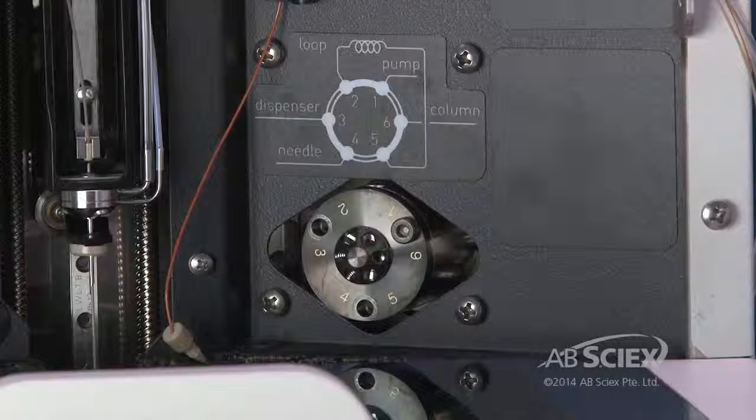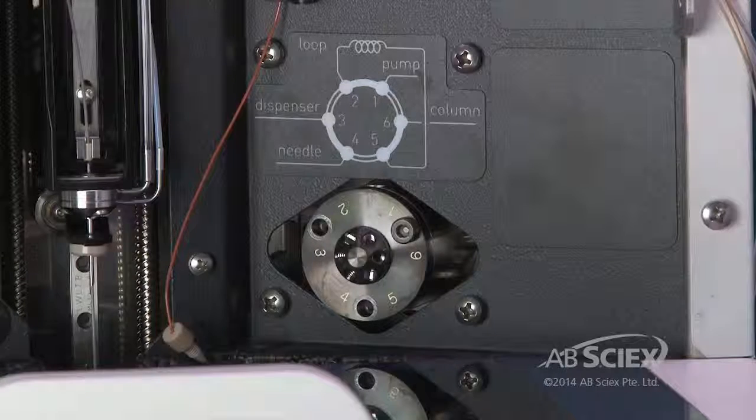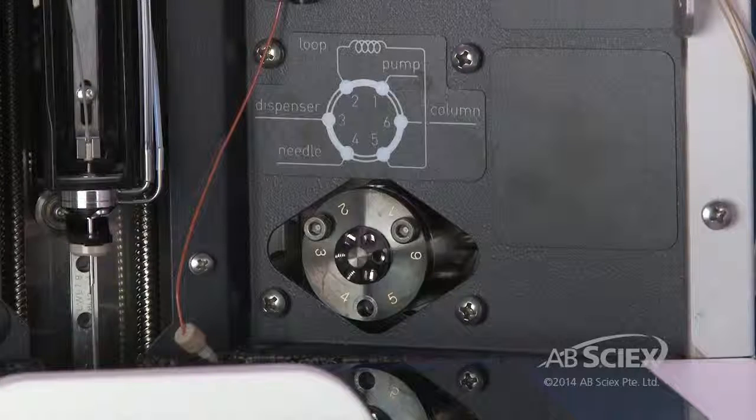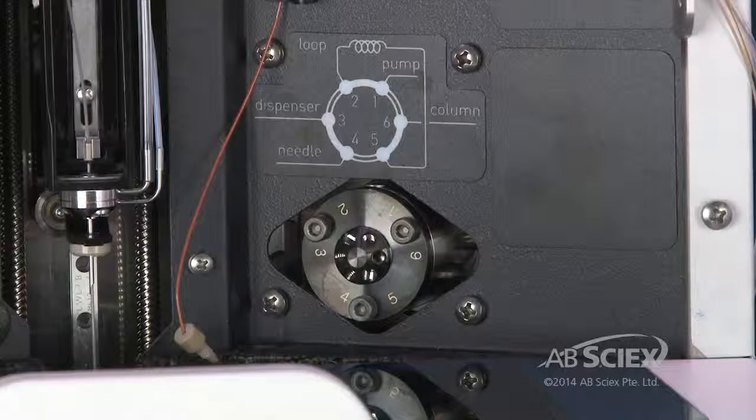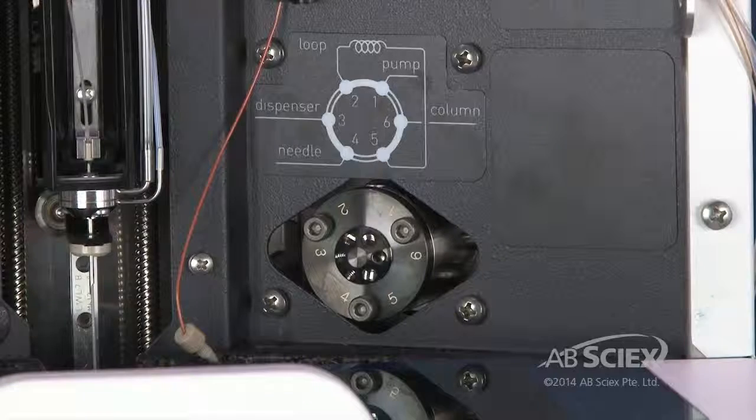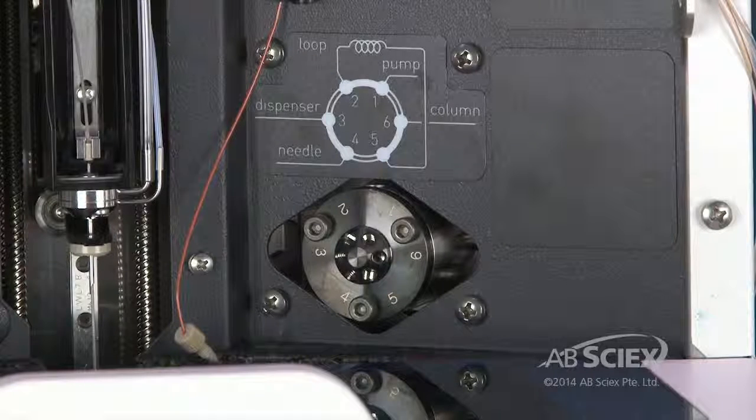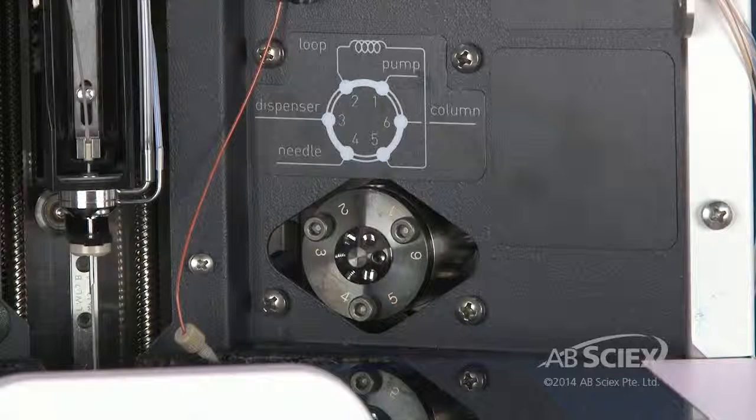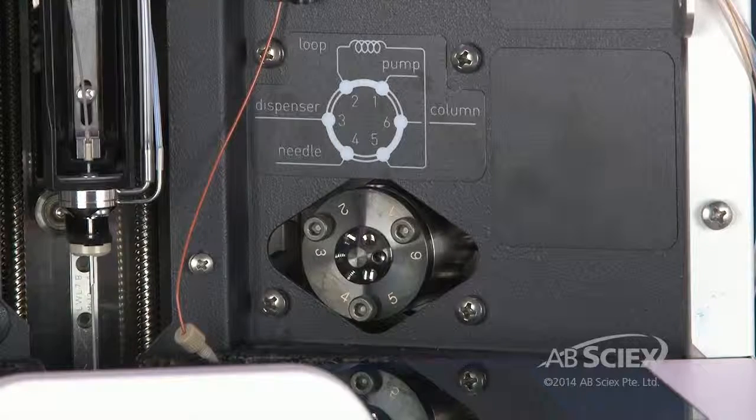Place one of the bolts into the bolt hole and tighten the bolt until slight resistance is felt. Repeat with the other two bolts. Tighten the first bolt completely. There are built-in stops so that the stator cannot be tightened too tight. Repeat with the other two bolts.